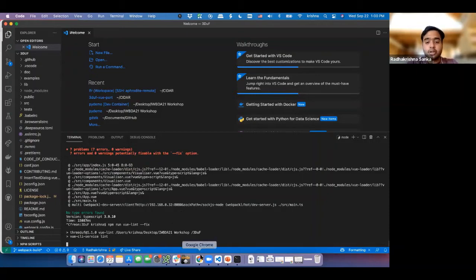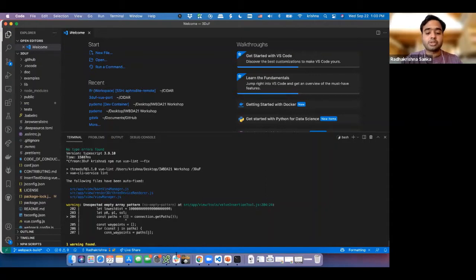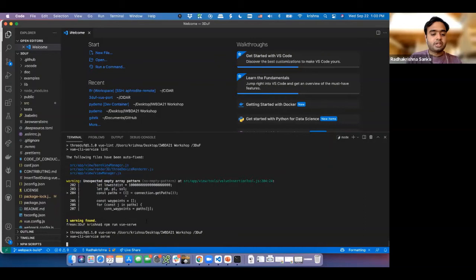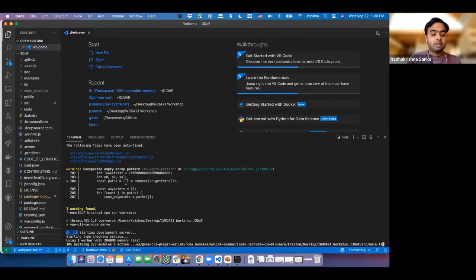Yeah, it is super easy. The way 3DuF is built right now is that it doesn't need any backend or any kind of computing resource, so it runs purely in the browser. So you can add any new workflow to it. In fact, the 3 different programming tasks we have today, which I'll be demonstrating, will go over the breadth of things we can do with the designs from 3DuF, both on and off 3DuF, like how to use the designs after. So let me run serve again. It should go a lot faster now because it might have done all the things earlier.